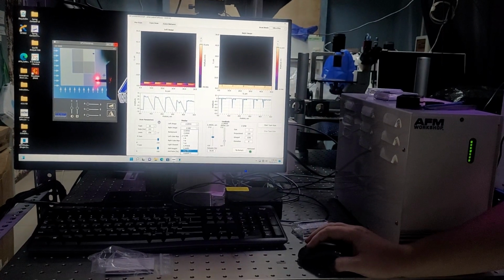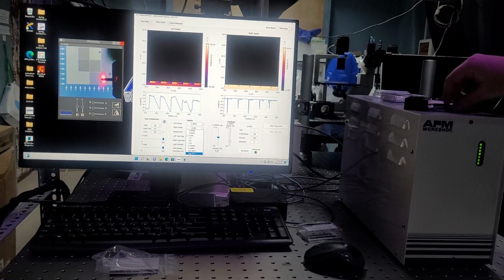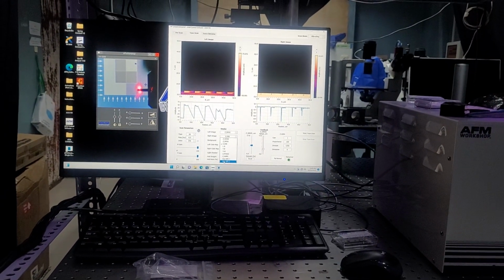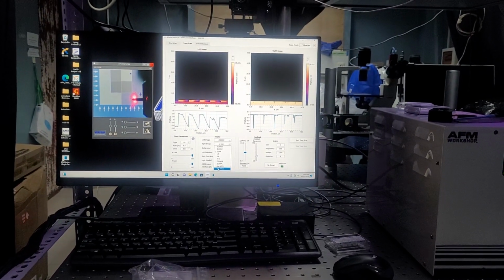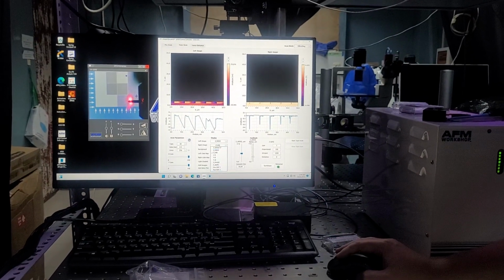And then aux ADC1 and aux ADC2. You will never use these channels. These are for auxiliary conductive devices, which in your case you don't have any conductive measuring tools, so you will not use those.